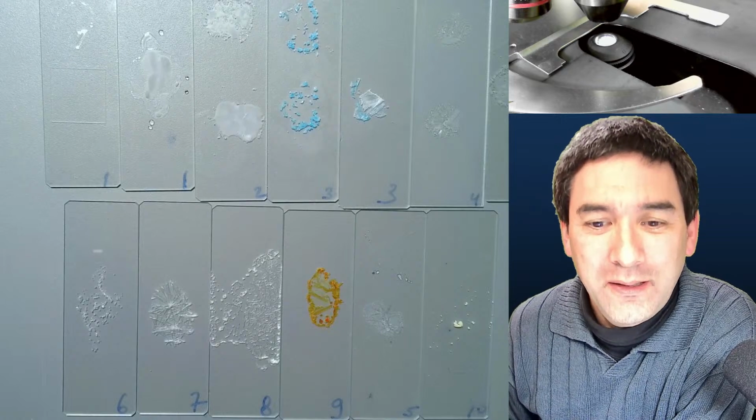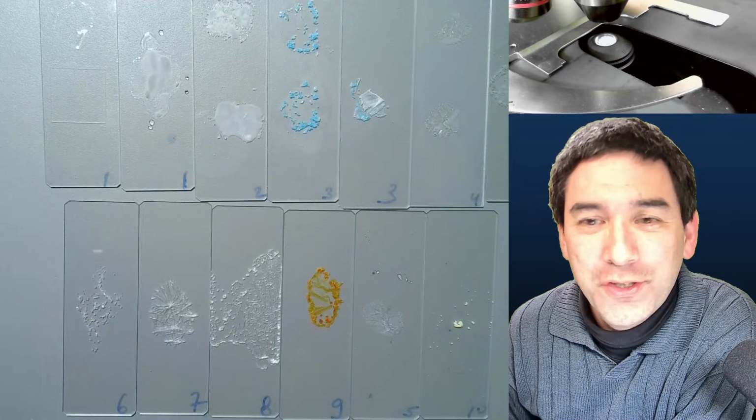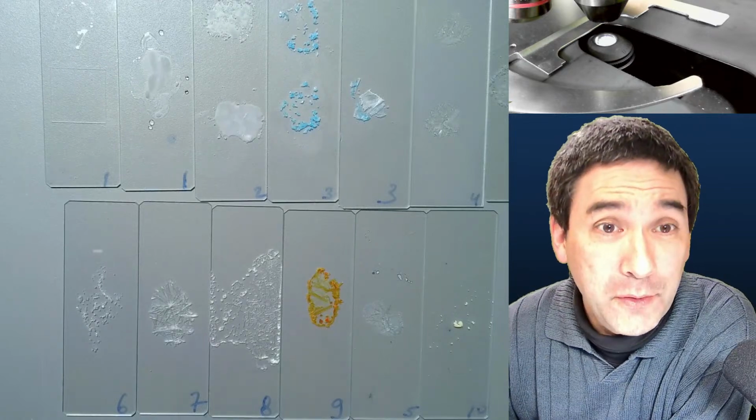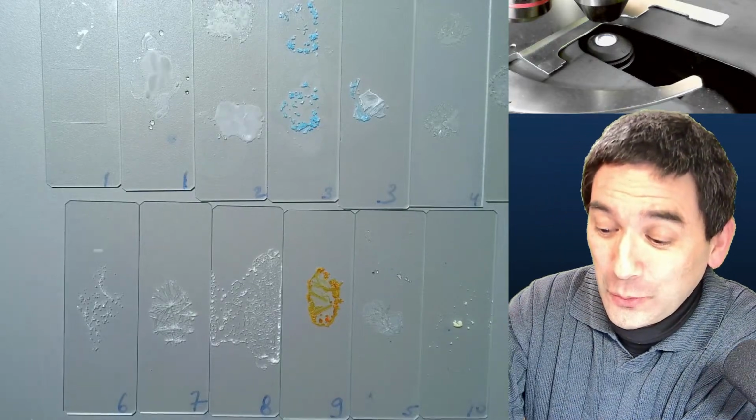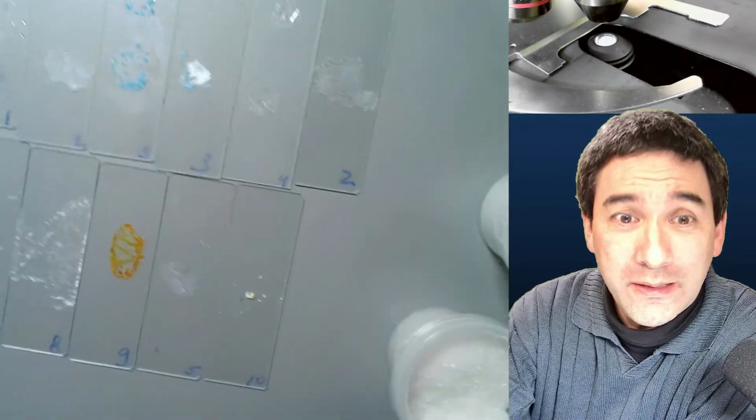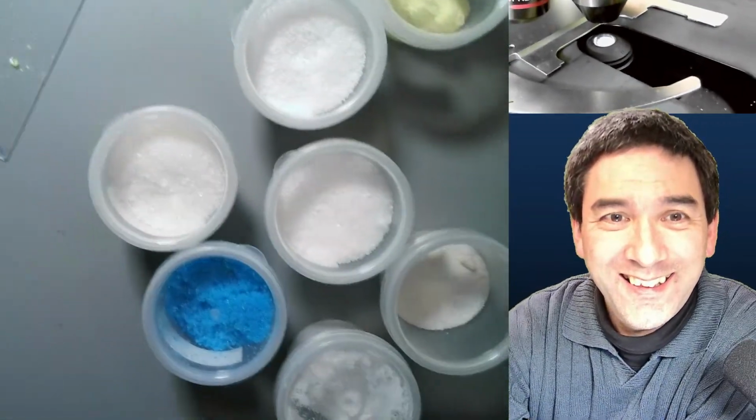Okay, well, welcome again, as I just mentioned. Today, as you can see, I've prepared a couple of microscope slides with different types of crystals on here. Look what I got here. I'm going to shift over the camera a little bit. Isn't this great?